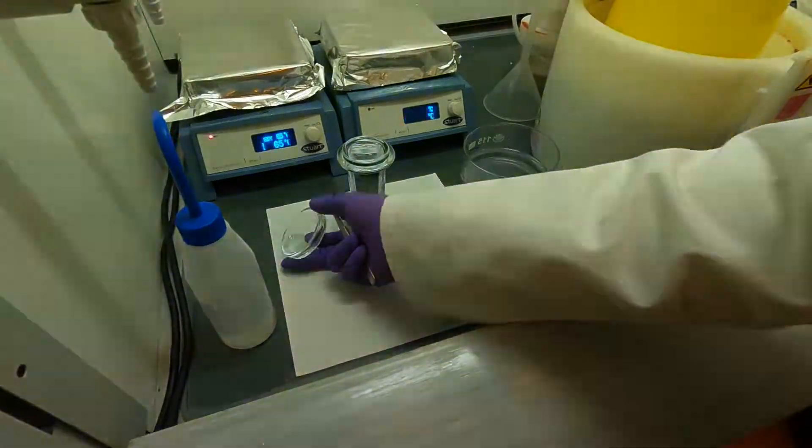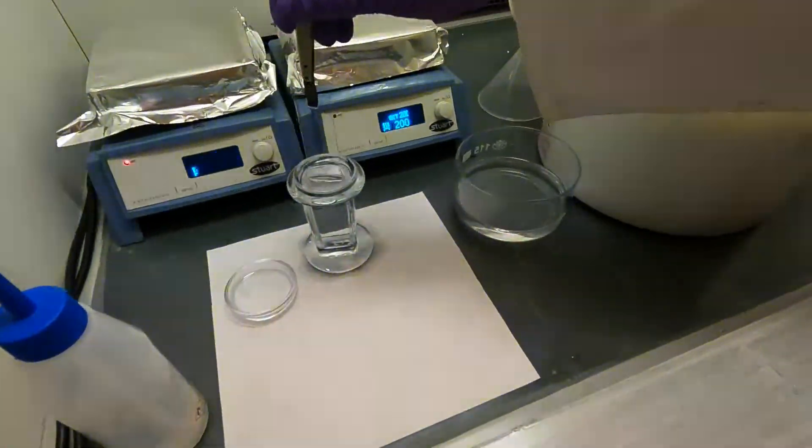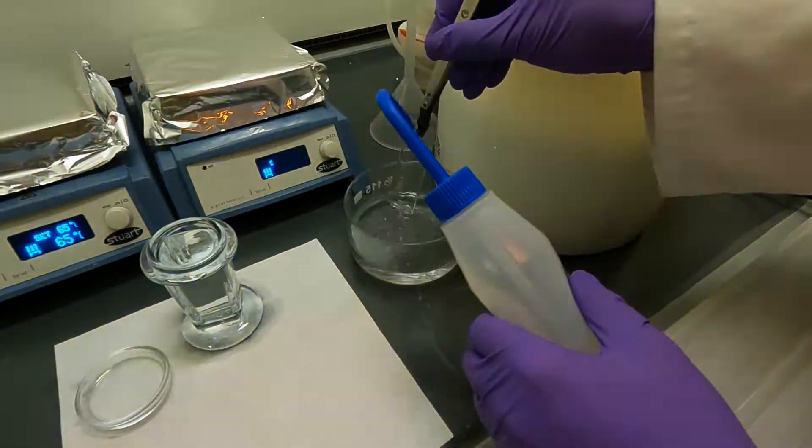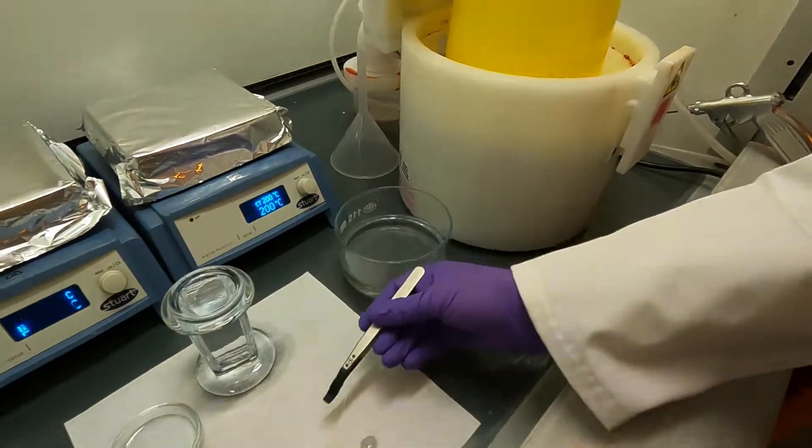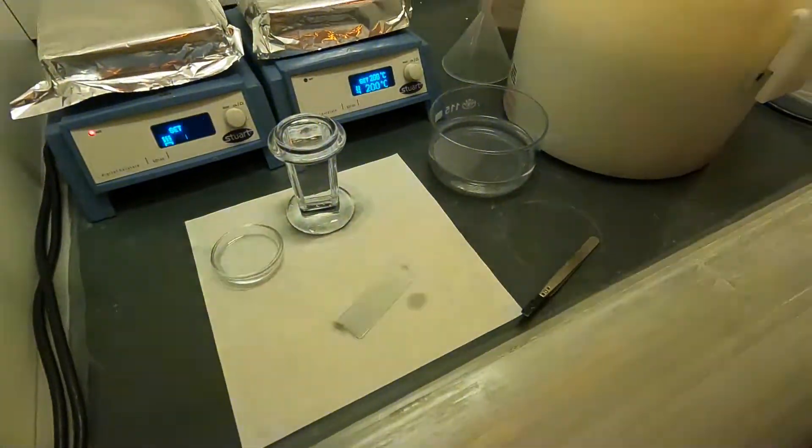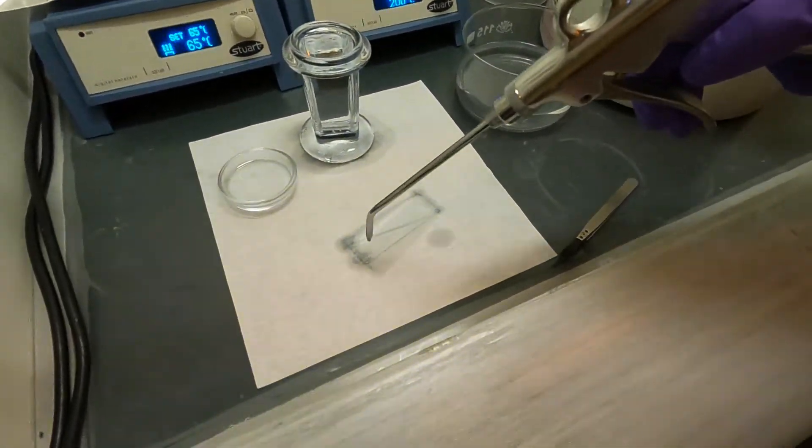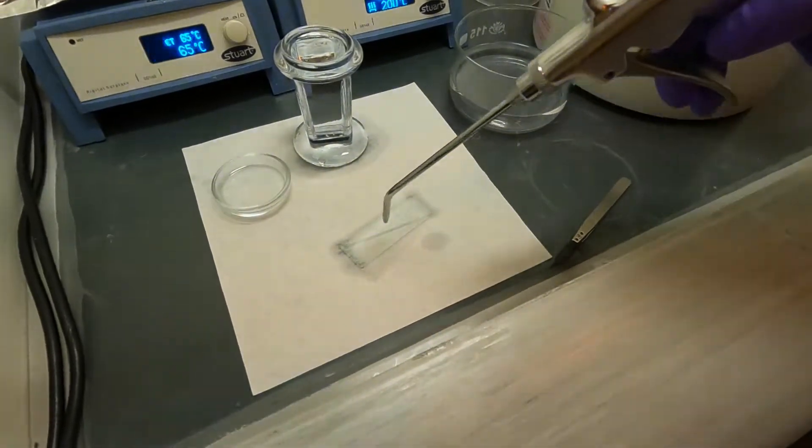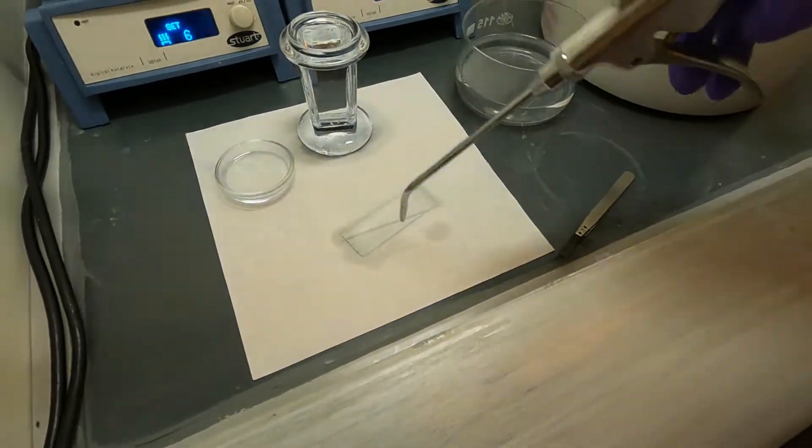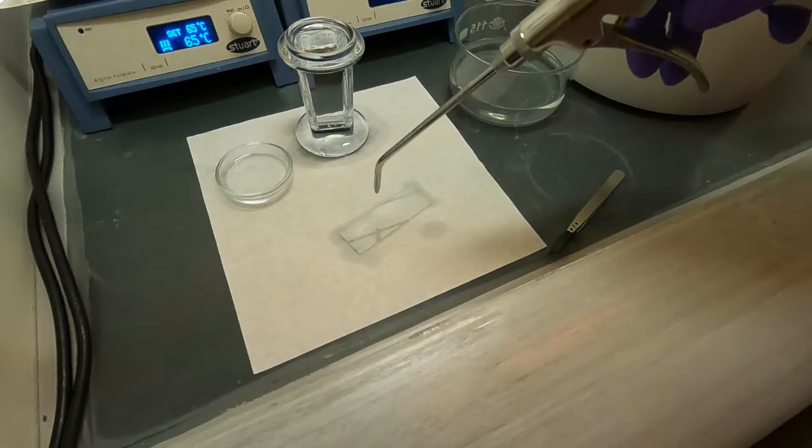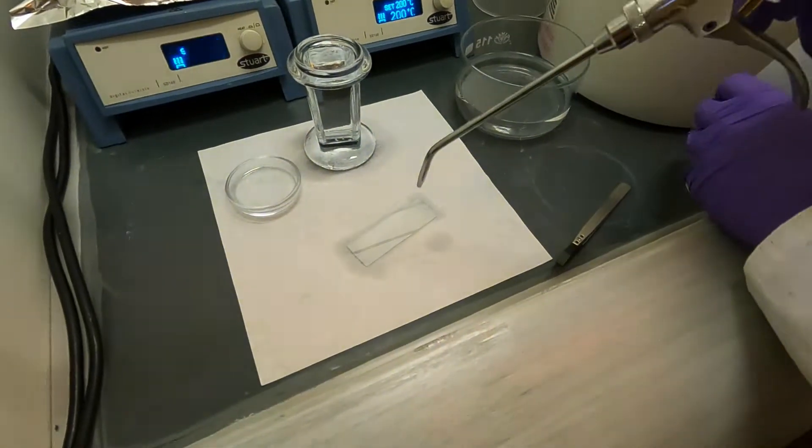You are now done with the rinsing and washing with the solvent. I'm going to take the glass slide out of the staining jar and rinse it quickly with isopropanol on both sides. Now we can blow dry the glass slide with an air gun. We pick up the air gun, put it on a clean room wipe, and blow it dry from the top surface. Be careful not to go past the edges here - the motion within the area of the glass slide is okay, but if you go past the edge you will start to move the glass slide around or it might fly off.